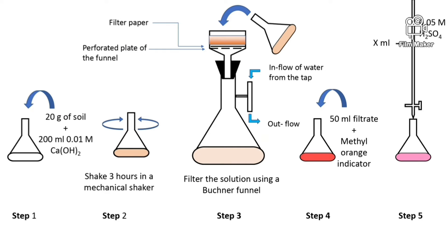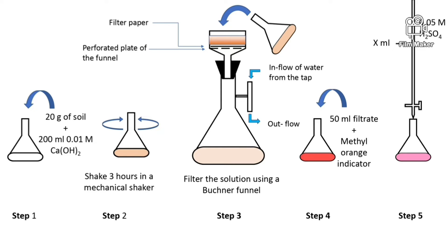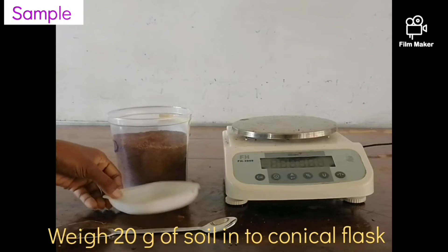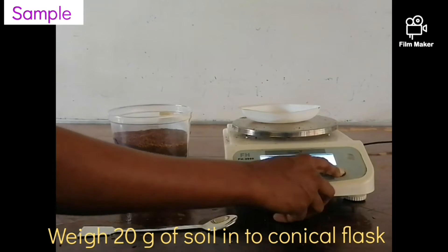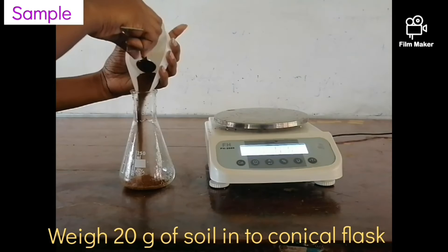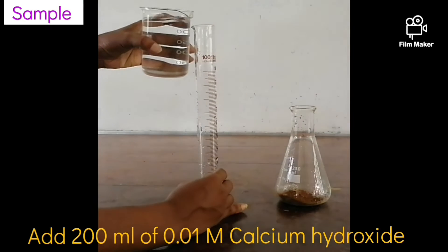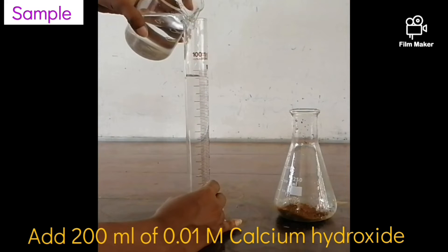This is the brief procedure of the practical. As the first step, you have to weigh out 20 grams of soil into a conical flask. Then add 200 milliliters of 0.01M calcium hydroxide solution into the same conical flask.